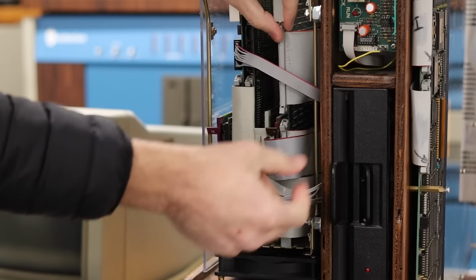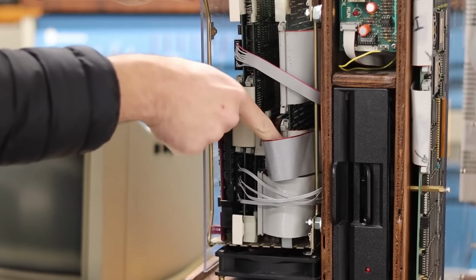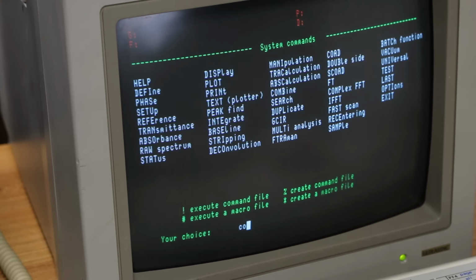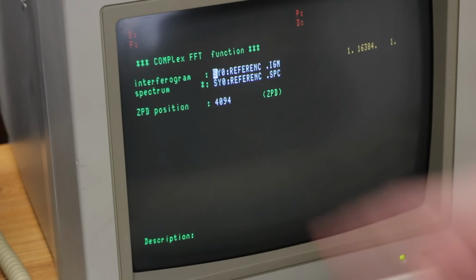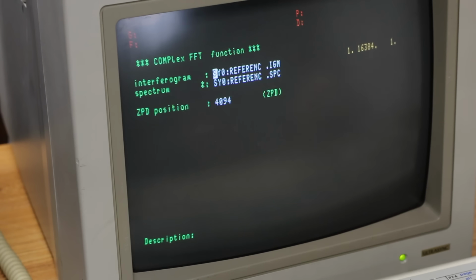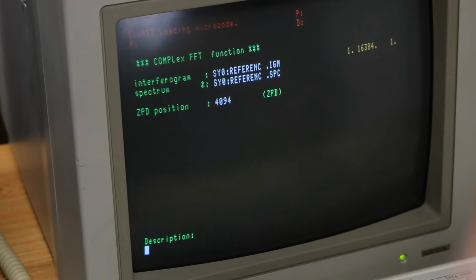And so like that was working before. And so I just shut it down. I double checked all the cables. So let's do something that's not involving the Bomem at all. Let's do a complex fast Fourier transform. So we're just gonna do a comp here, and we're just going to use the reference interferogram here. I'm just going to hit enter on this. And yeah, wait, loading microcode.